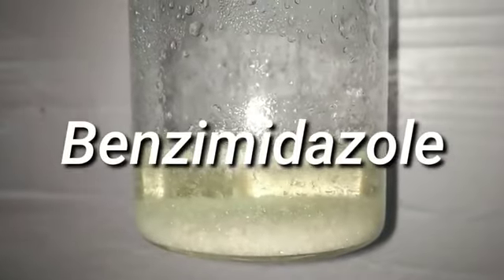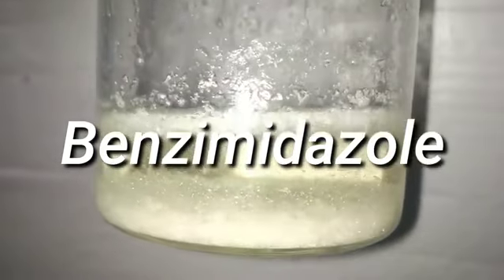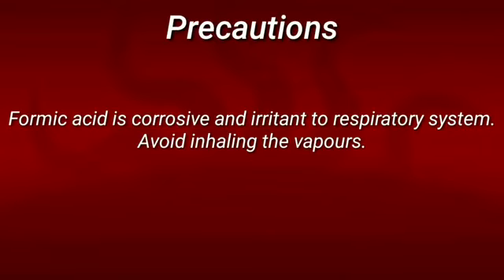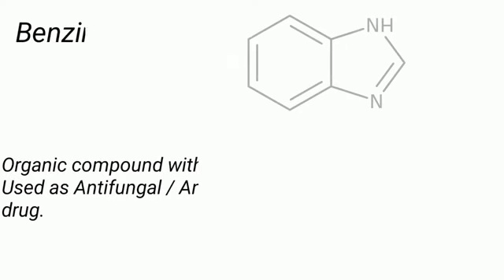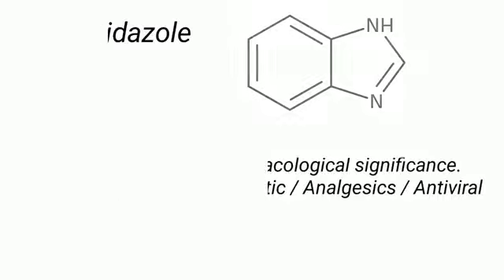Hello friends, in this video we will synthesize benzimidazole by the condensation of orthophenylene diamine with formic acid. Benzimidazole is an organic compound with pharmacological significance. It is used as antifungal, antiparasitic, analgesic and antiviral drug.